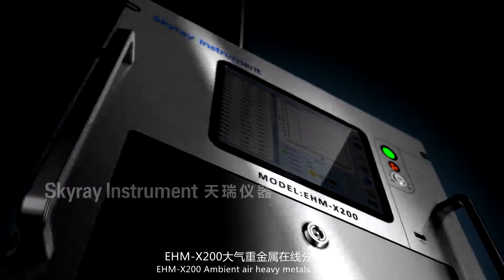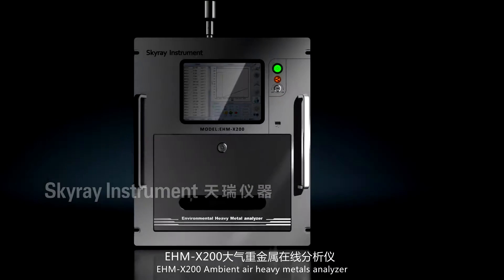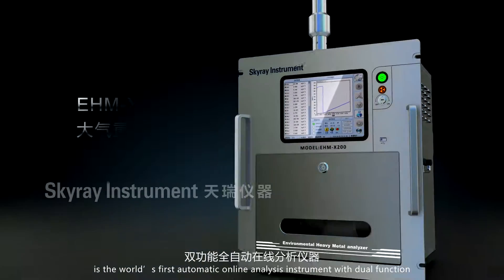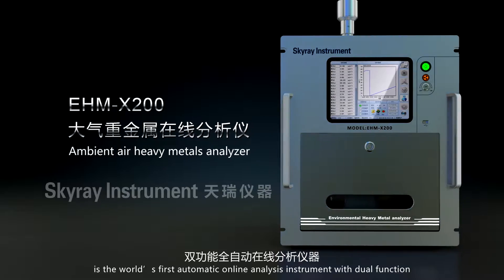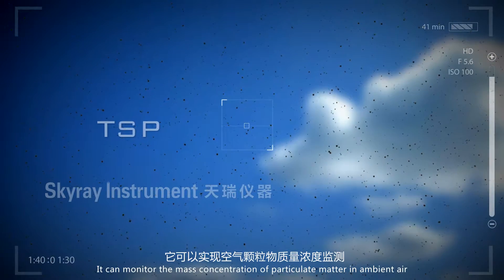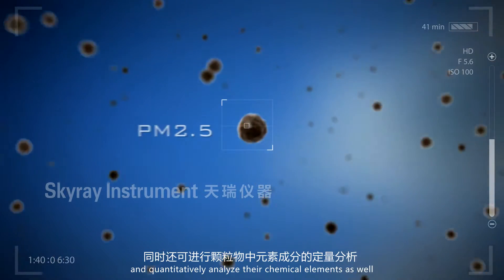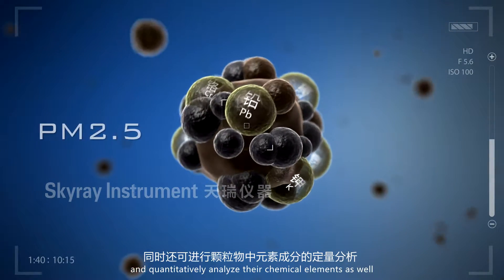EHM-X200 Ambient Air Heavy Metals Analyzer, created by SkyRay Instrument, is the world's first automatic online analysis instrument with dual function. It can monitor the mass concentration of particulate matter in ambient air and quantitatively analyze their chemical elements as well.